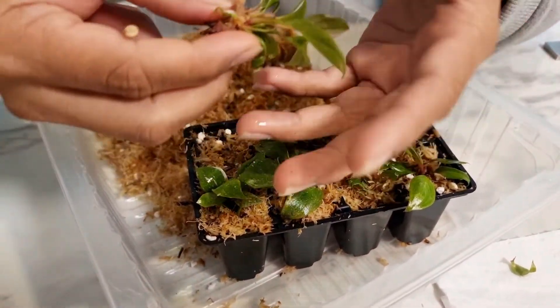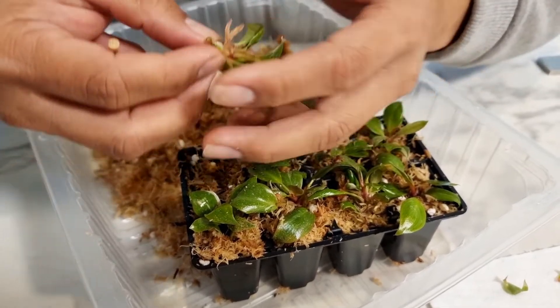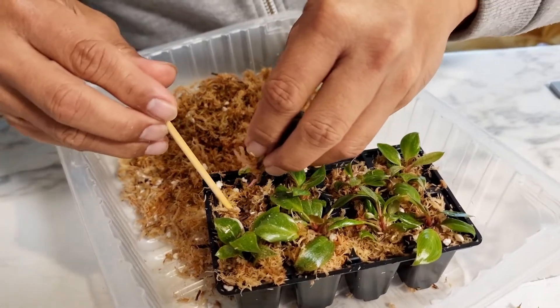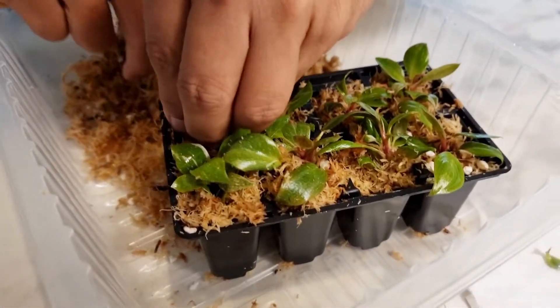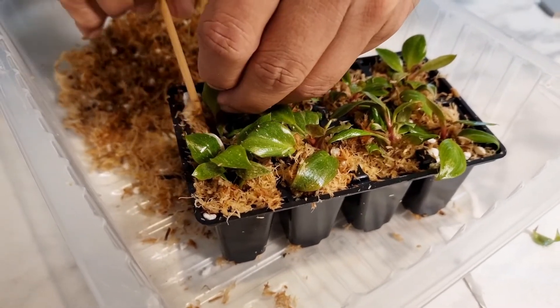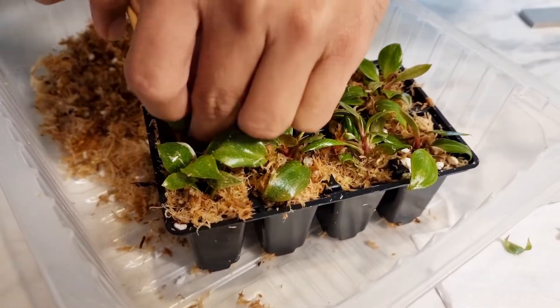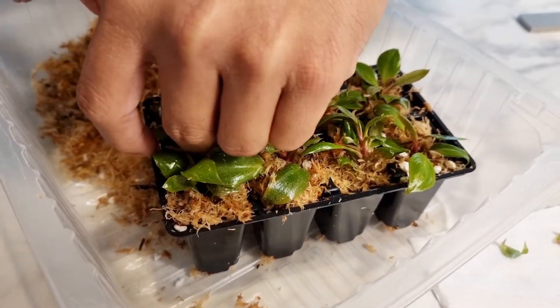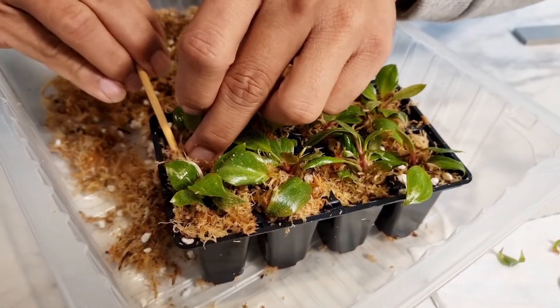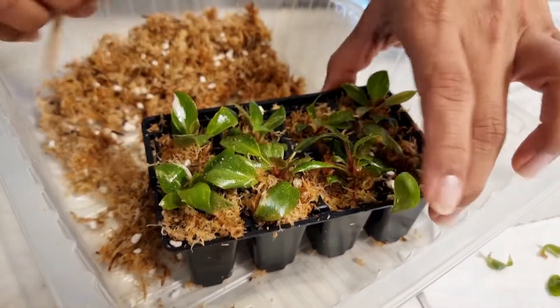Here's a tip on how you handle it: position the leaves, that's the hole there, push the plant in, then put more media on the side using your stick. Push the media in on the side to hold the plant in position. Add a little bit more media — and that's it.